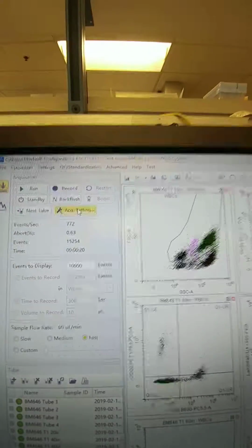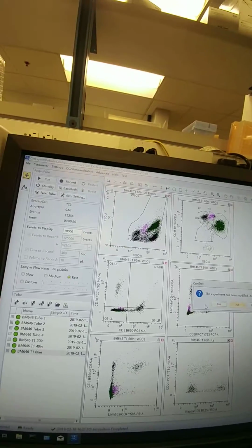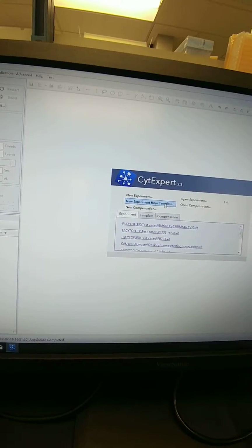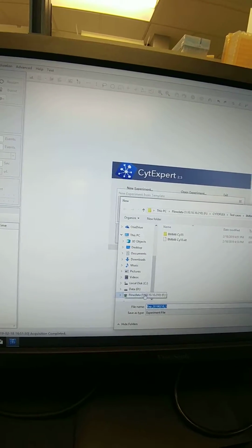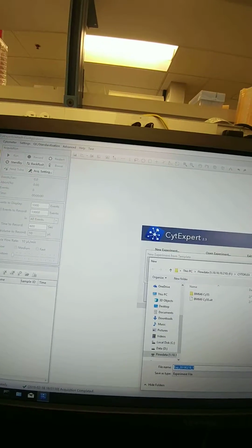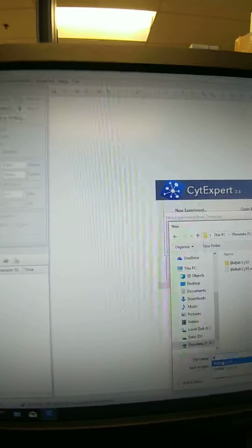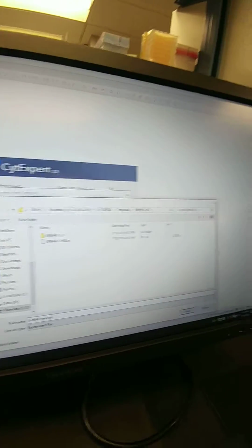So now let's go ahead and clear this out. Experiment modified, save it, I'll hit yes in case. Alright, I'm going to run that again, so I'm going to do a new experiment from template. Browse, and this is just like you normally do. Here, it's already in the correct folder. I'm going to call this for me BM646 New Gains.